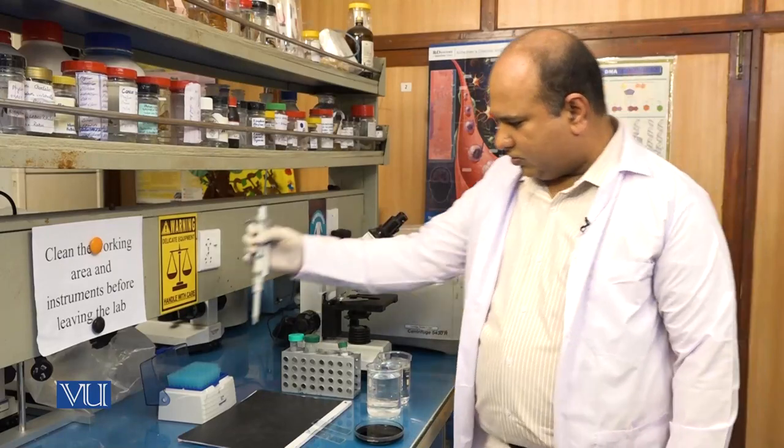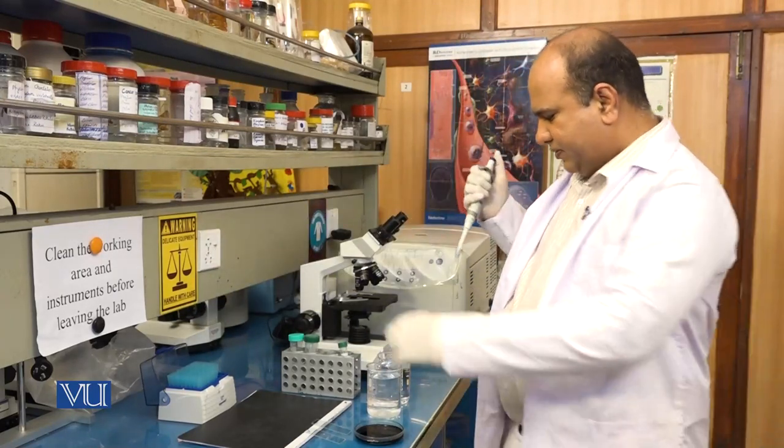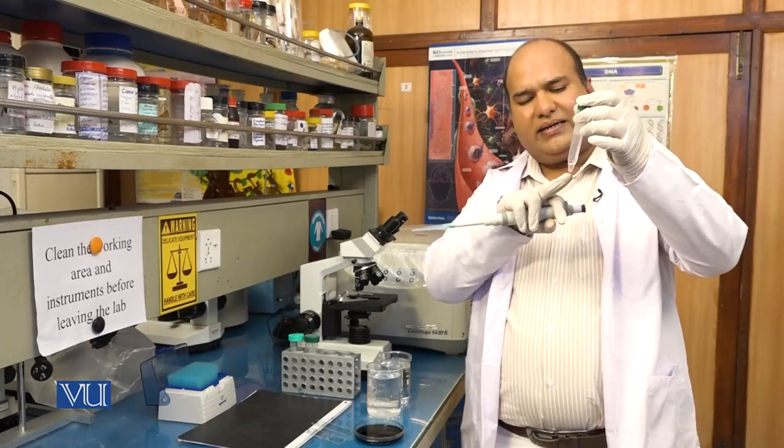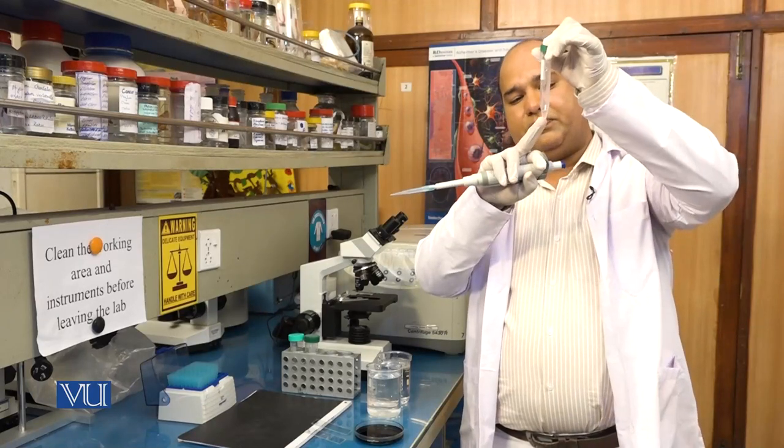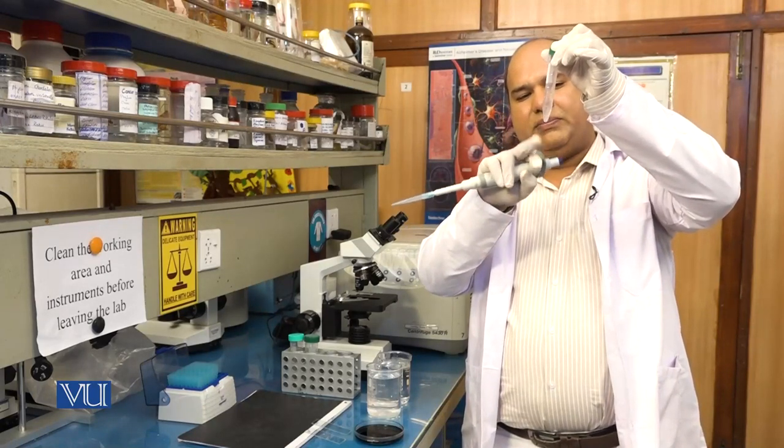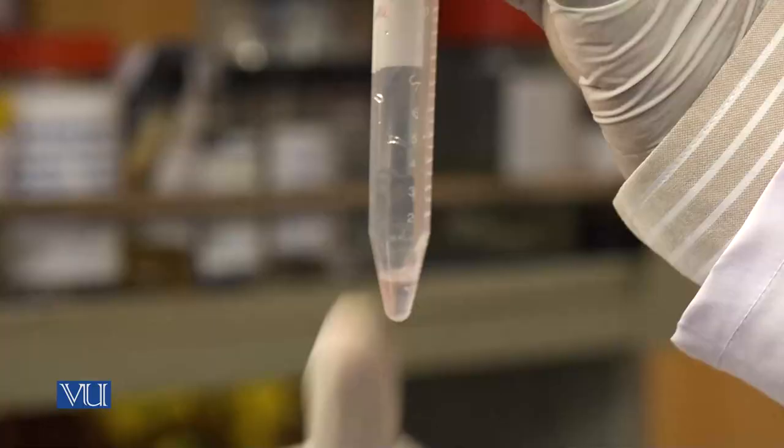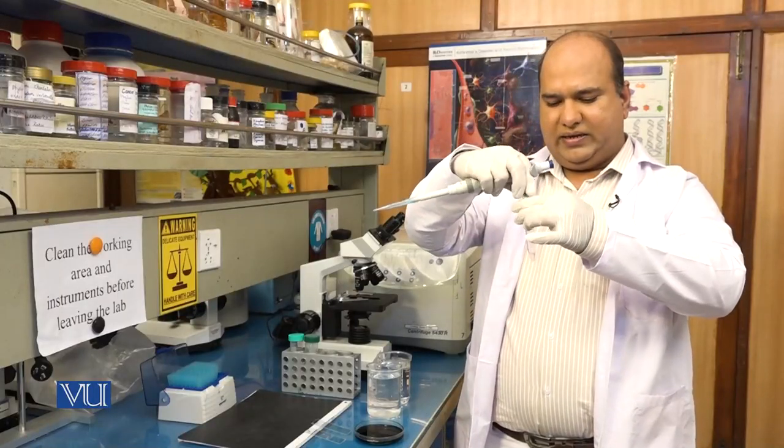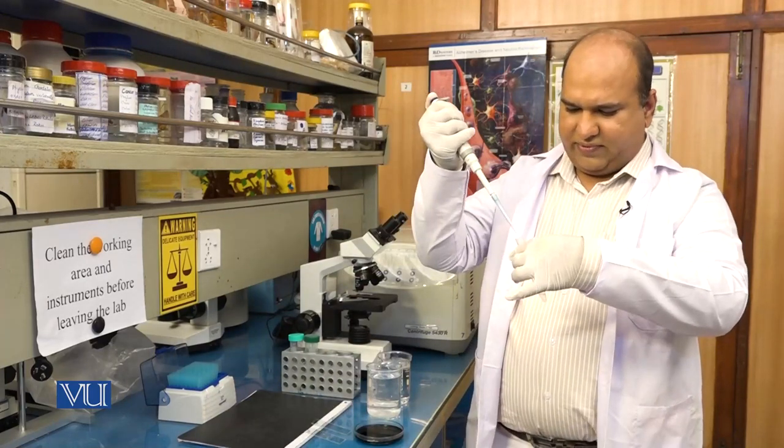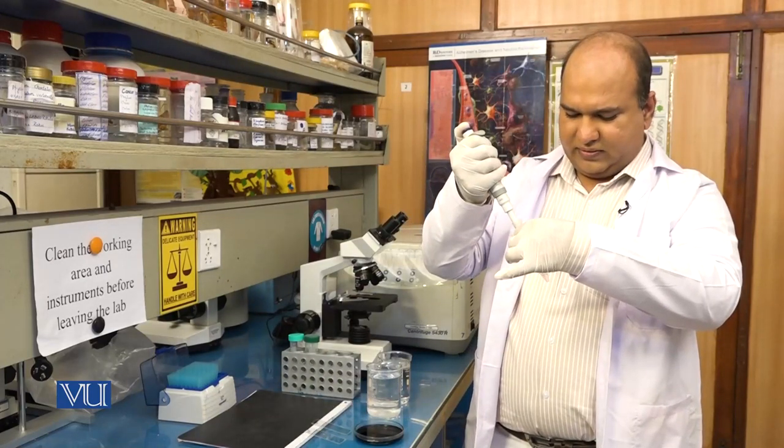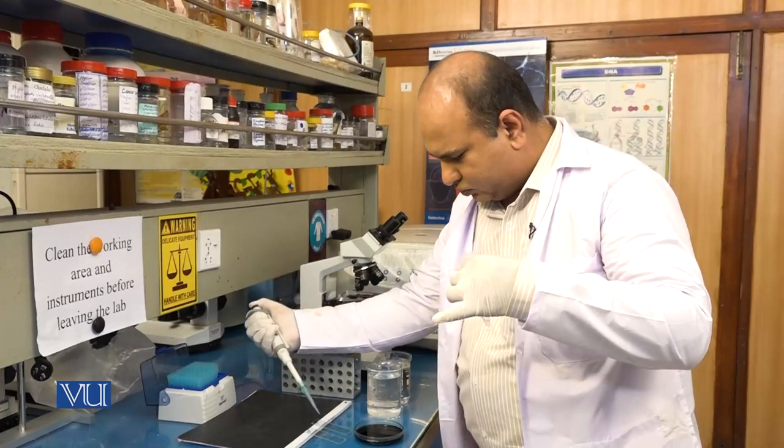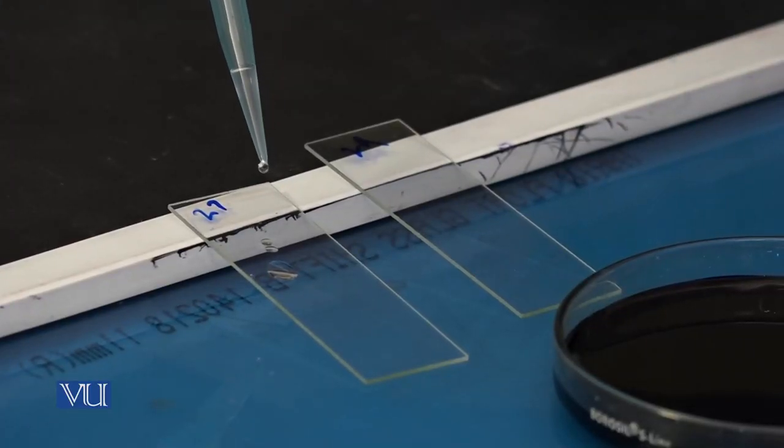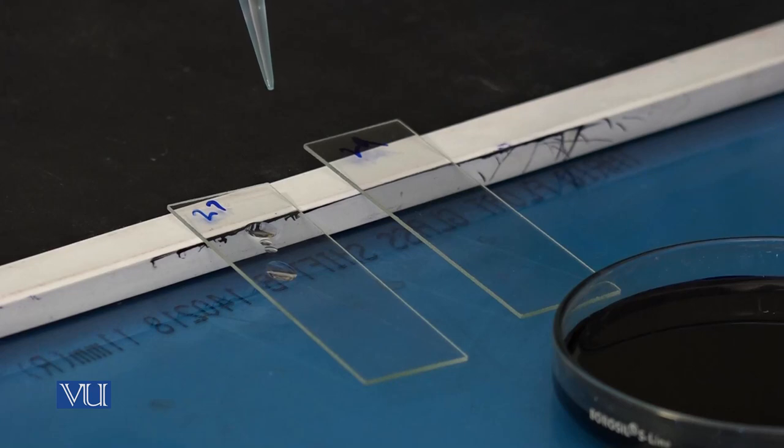Now again I take this tip. This is the supernatant. Keep in mind that this is one of that supernatant which was quite clear and it has pellet in it. Now I mix it well so that the pellet gets mixed in it, and I will take around, let's say, 500 microliters of it. Thus I will add two to three drops on each slide.